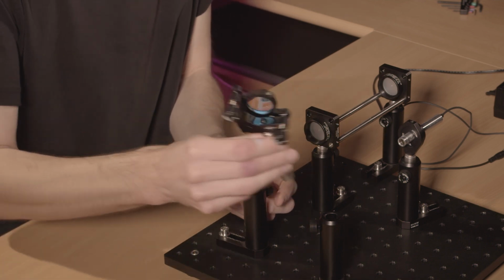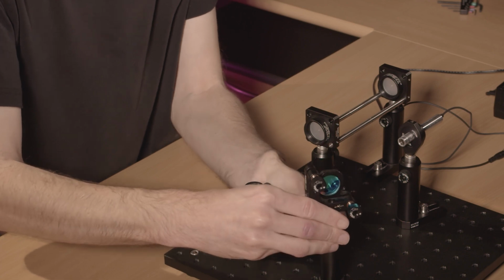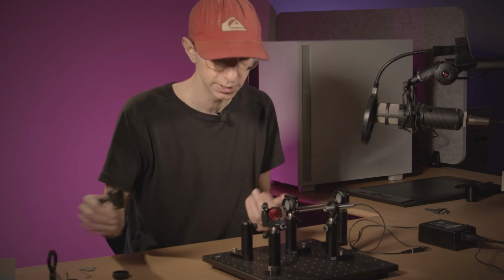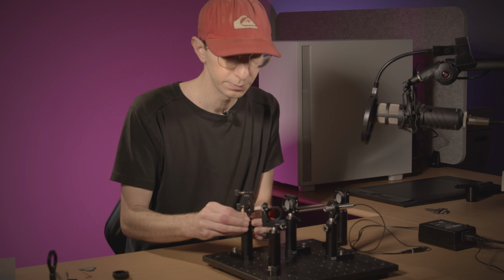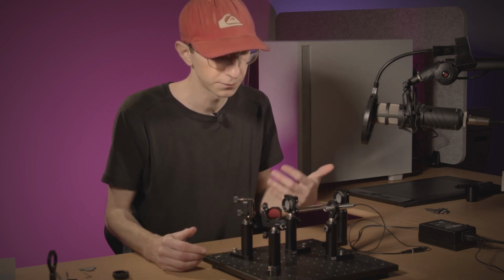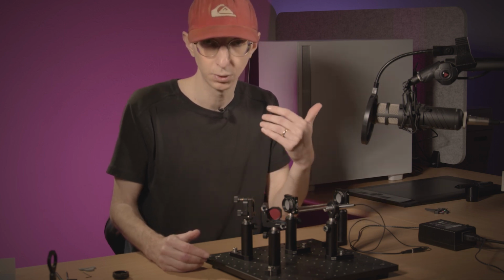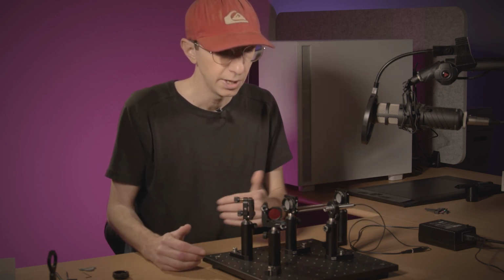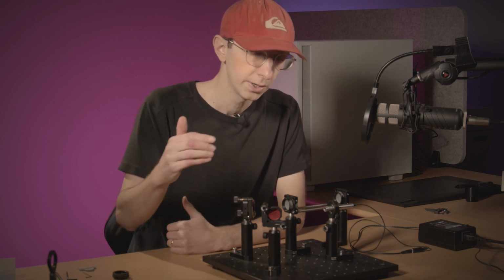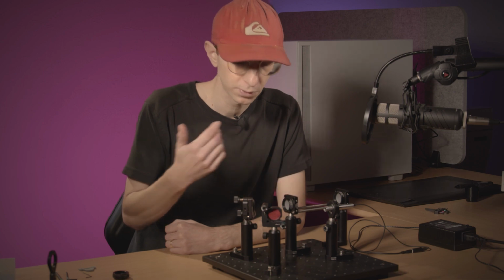And I will use two mirrors. You don't necessarily need to use exactly two mirrors. You could use one mirror and put tilt or offset position on the laser itself. As long as you have your 4 degrees of freedom, that's fine.